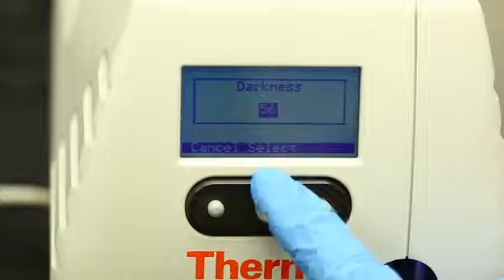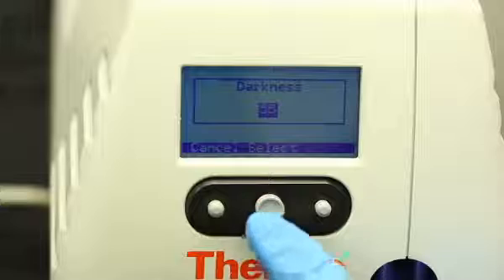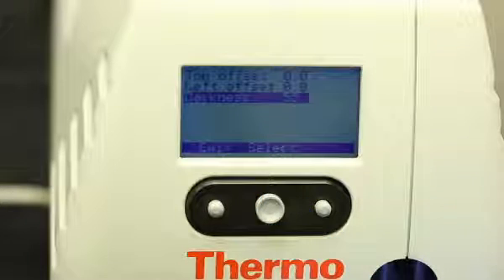Do not adjust the darkness over 60. Run at least 10 slides to verify the changes. If you are still having poor printing after checking your slides and adjusting the print, please call labeling support in your area for assistance.